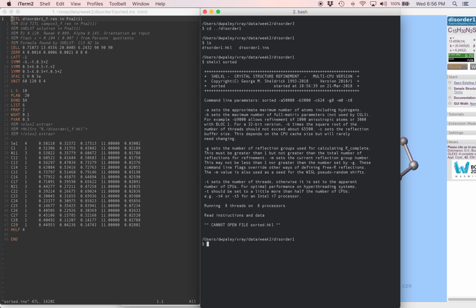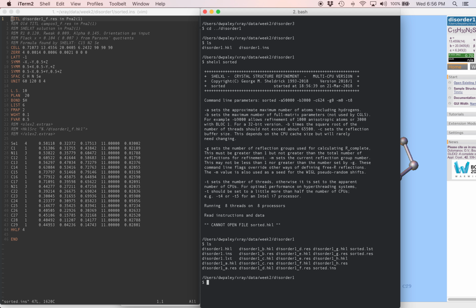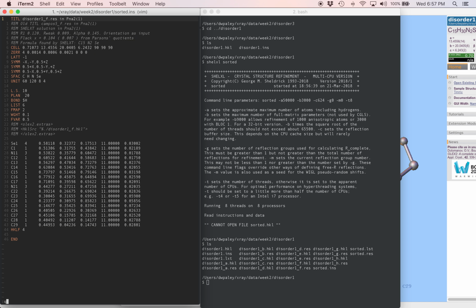Cannot open file sorted.hkl. That's because we didn't make a HKL file for this. Now, let's look at the files in this folder. For each one of the possibilities that SHELXT gave us, there's a res file which has the structure, and there's also a separate HKL file for each one of those. I'm going to need my other terminal window back and get out of here for a second.